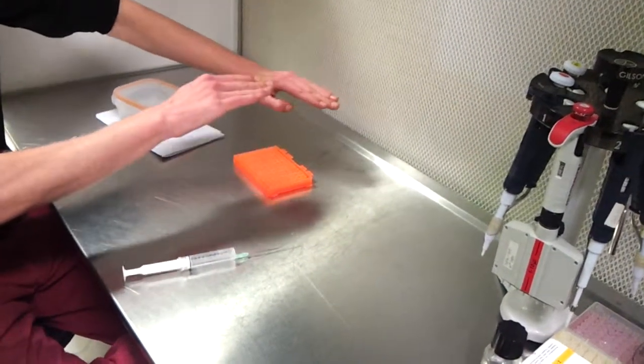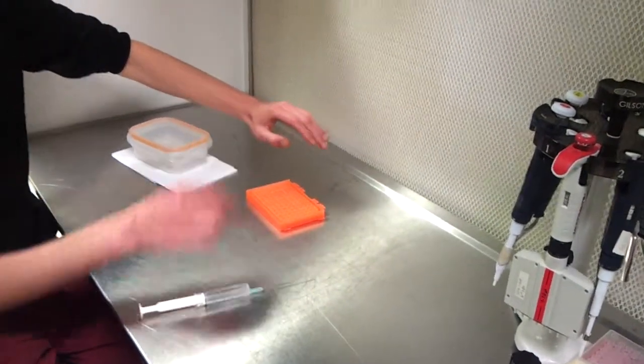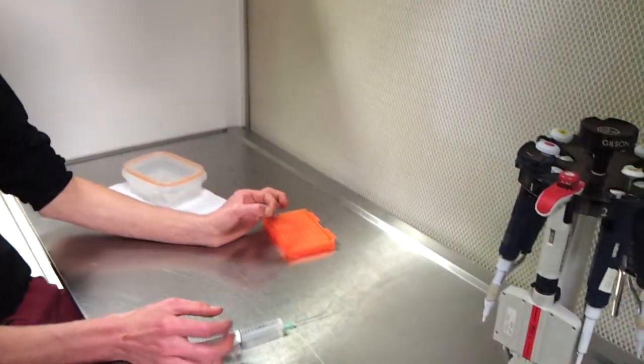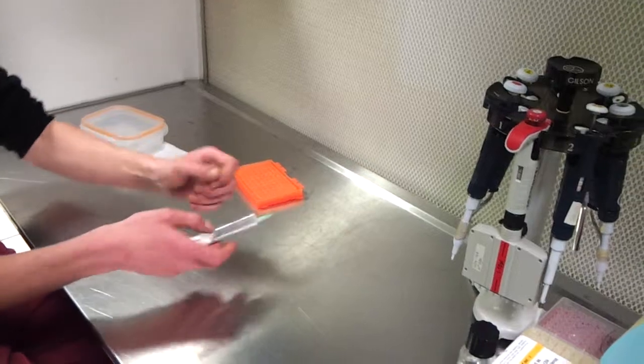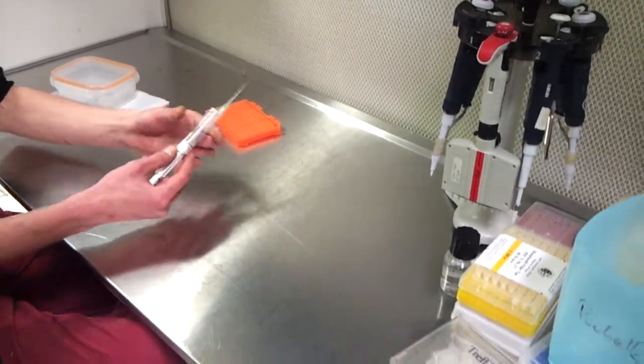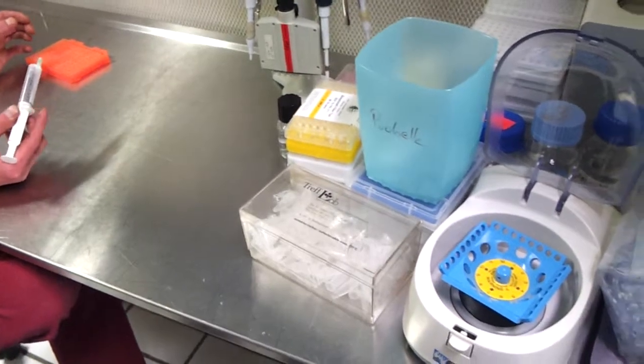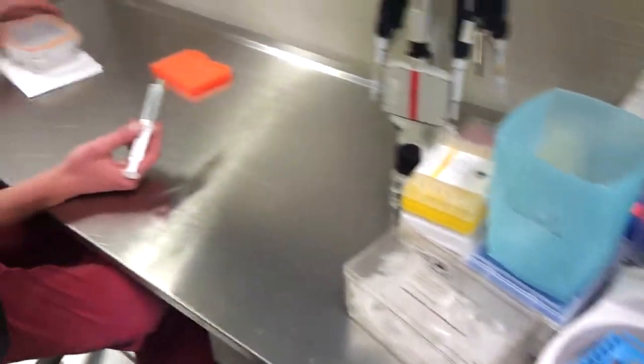For the glass to be in the right place, you have your glass, you can open your aluminum sheet, and you will take this.